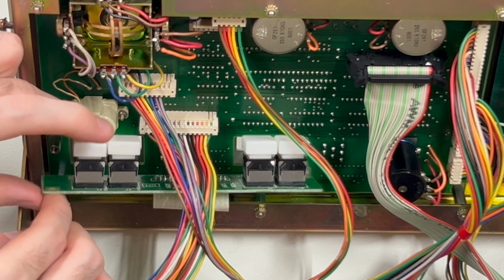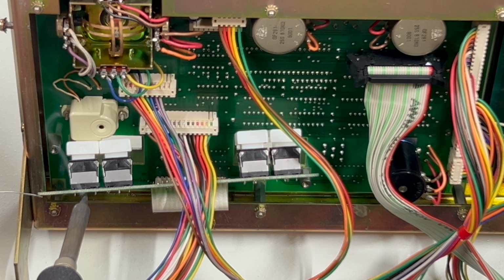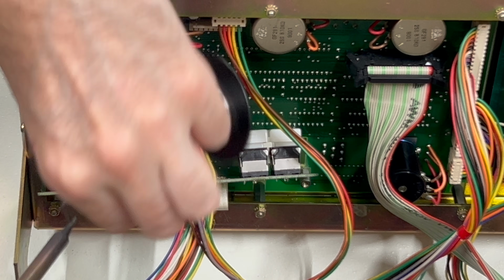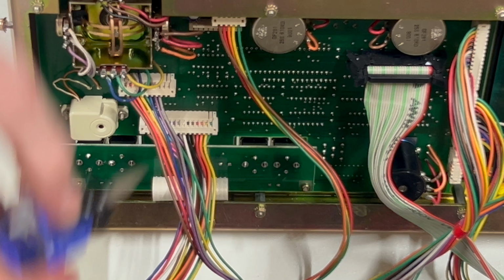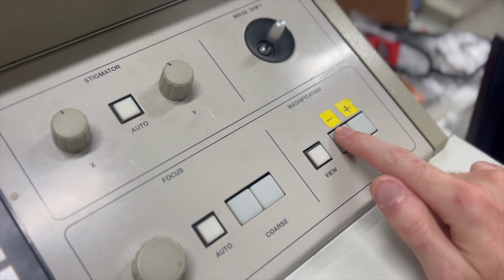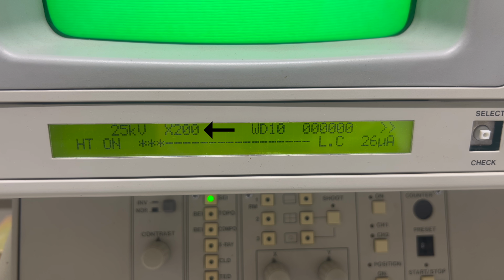Okay, time to solder the switches back in. By the way, I did fully power down the unit before doing this, just in case you were worried. Okay, everything is back together. Let's see if I can change the magnification now. Okay, well, the LCD at least says the magnification is changing, but I don't really see any change on the screen. Well, actually, when I zoom all the way out, it does look like something maybe.